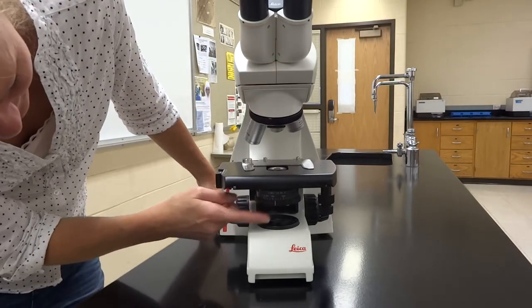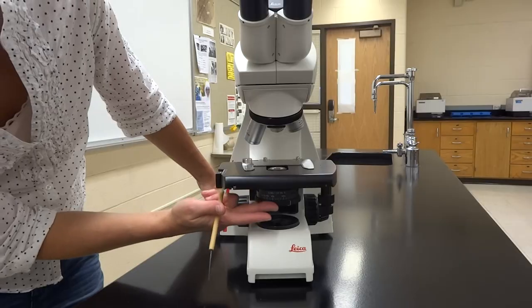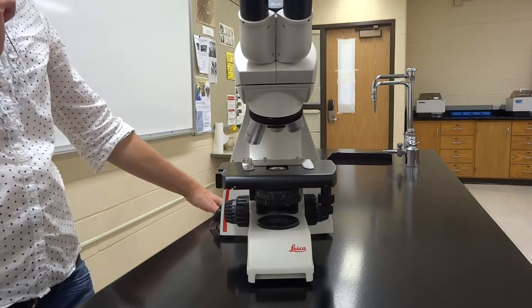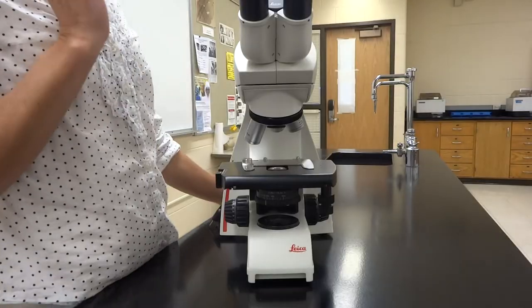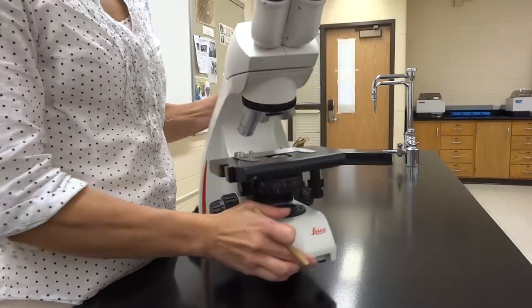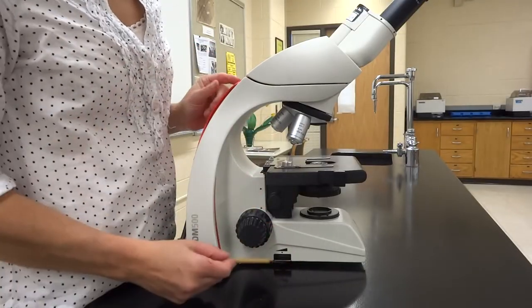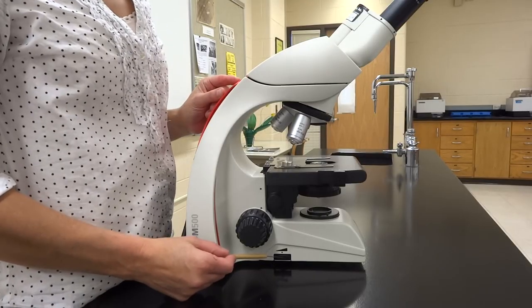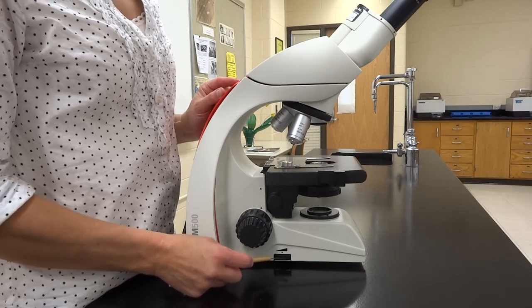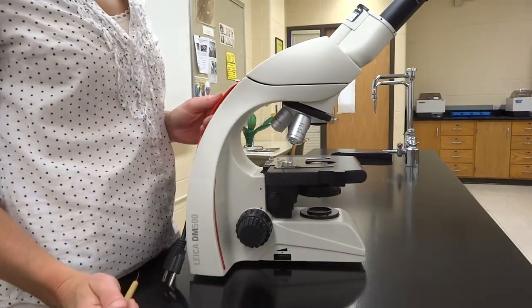The condenser is controlled by the diaphragm — there's a little spinning piece that will help adjust your light level. You can make it brighter or lower so you don't damage your retinas. You can also adjust the light using the rheostat, the knob on the side of the scope at the bottom. Between the rheostat and the condenser diaphragm, you'll be able to fully control the light level.